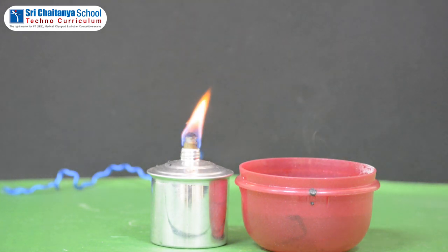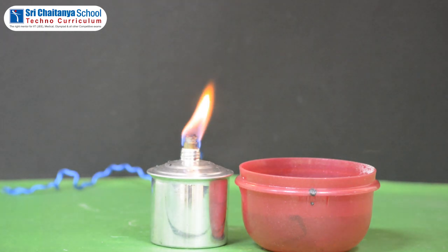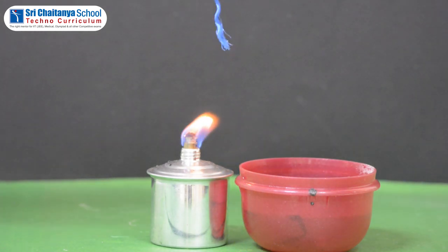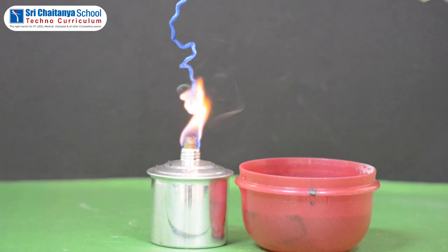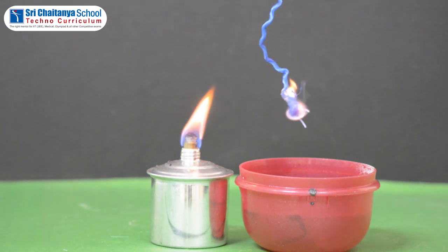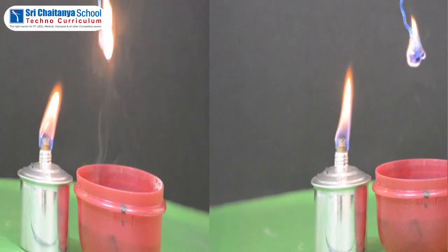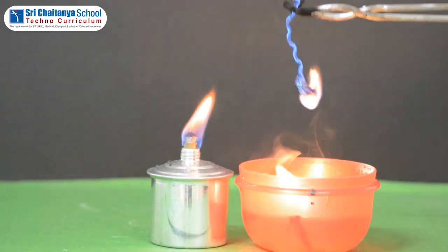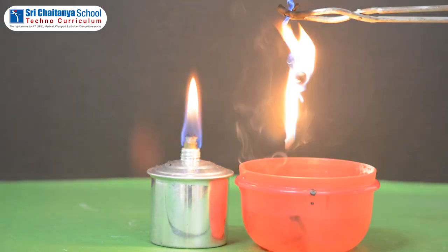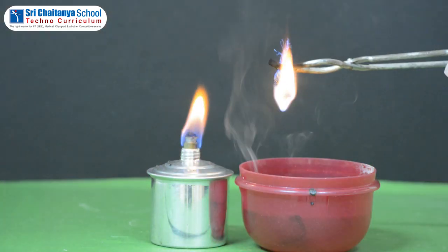Next, hold a small piece of synthetic fiber like nylon with tongs and burn its one end with a spirit lamp. Check the following: how does the fabric catch fire, and the smell after burning. Record your observations in the table.